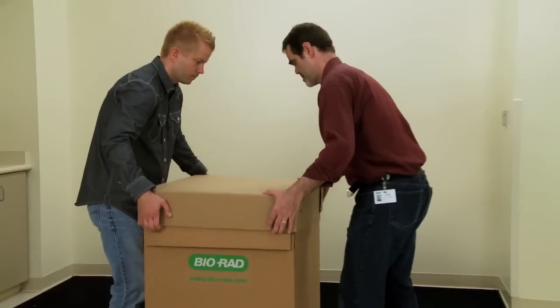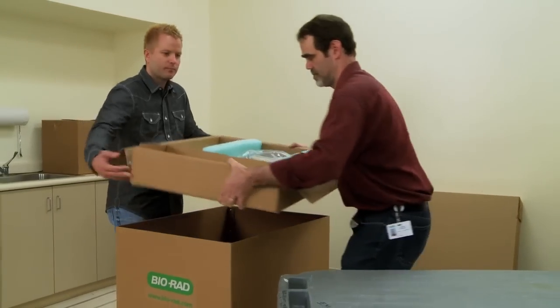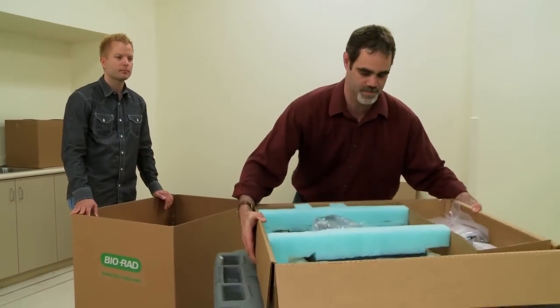Next, remove the top cover from the shipping box. You will want to remove the top box that contains the buffer tray, touch screen, and accessories.